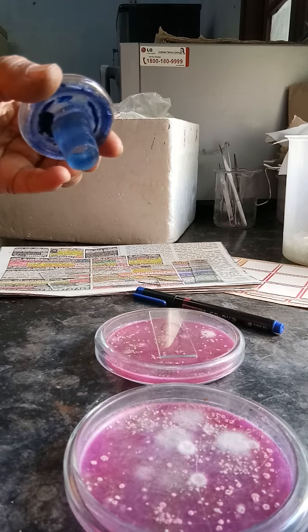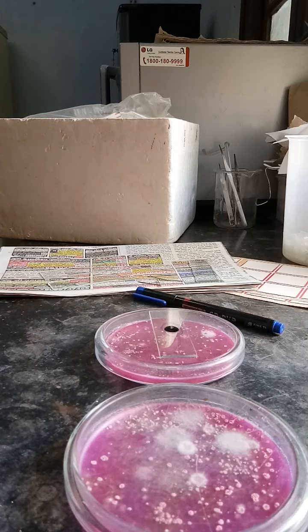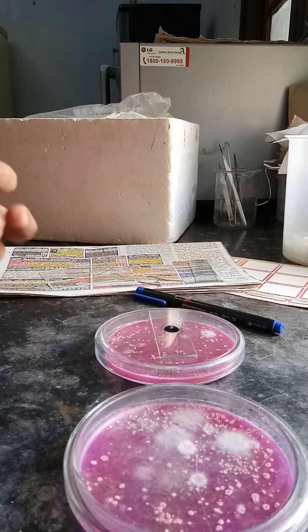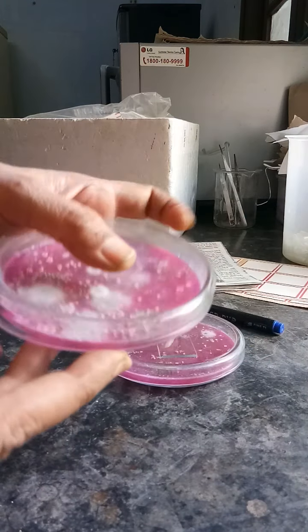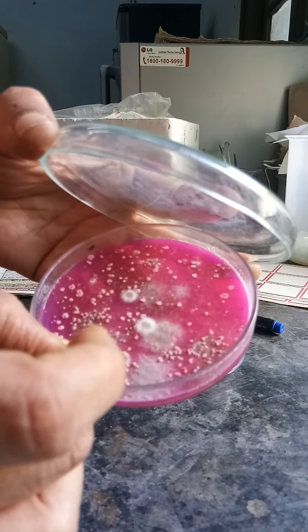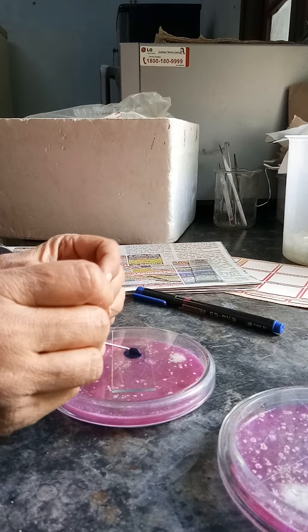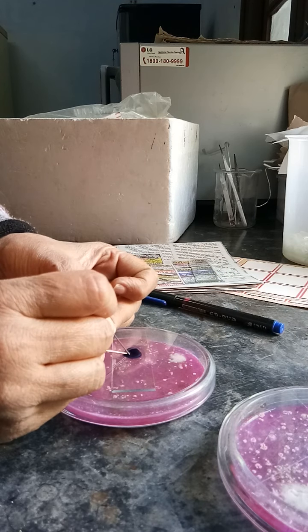First of all, we will take a drop of the lacto phenol solution and put it on the center of the slide. Now we are going to take the material from the fungal media. You can see that very gently I am opening the fungal media and then taking a little amount of the fungal growth from the plate. The fungal growth is already on the tip of the pin.